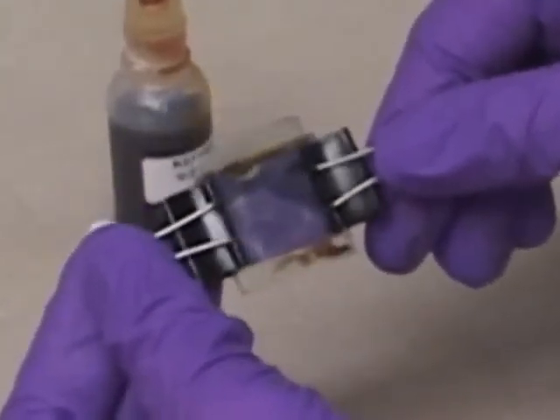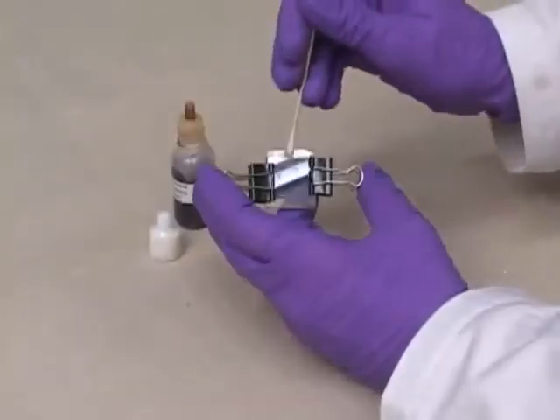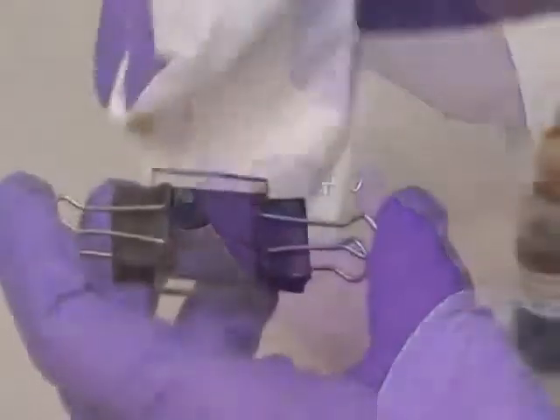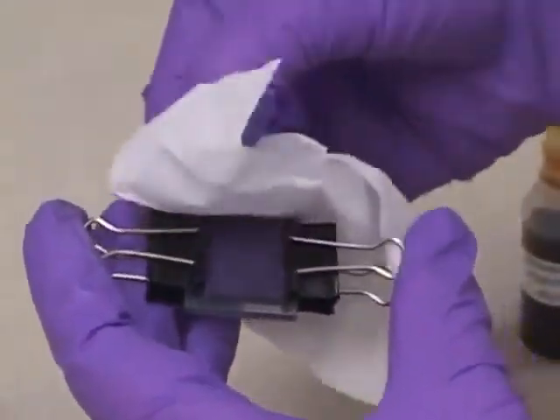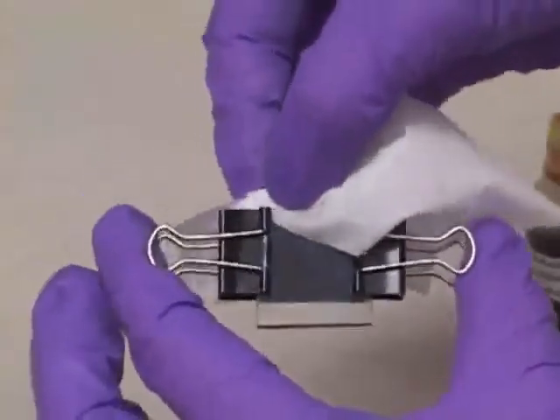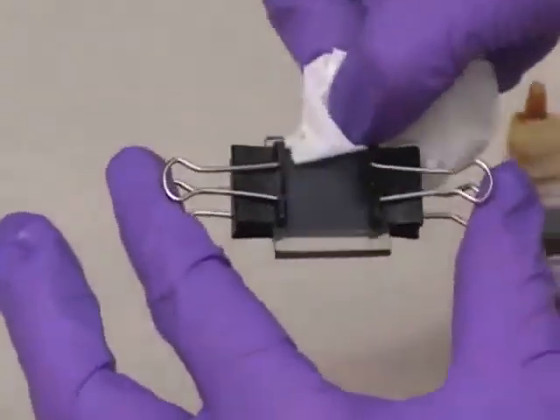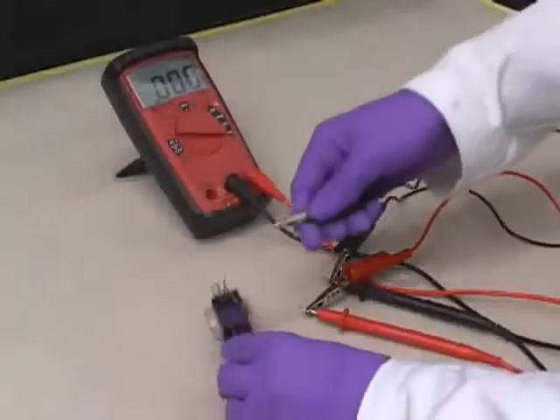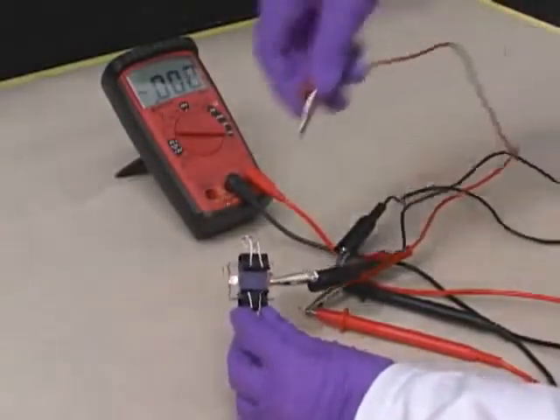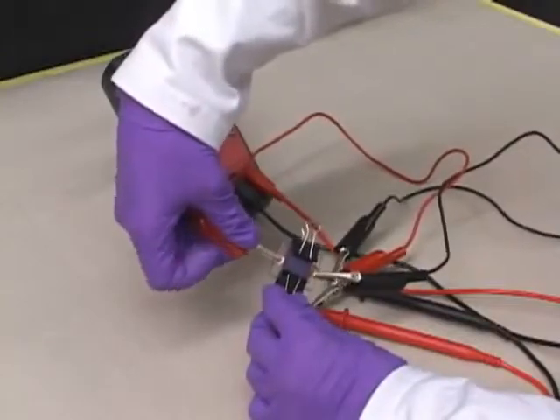Make sure that all of the stained area is contacted by the electrolyte. Step 7: Wipe off the excess electrolyte solution from the exposed areas of the glass using cotton swabs and tissues dampened with ethanol. The cell will not work well if there is any electrolyte solution left on the exposed areas where the alligator clips attach. Step 8: Fasten alligator clips to the two exposed sides or poles of the solar cell to make electrical contact to the finished device.